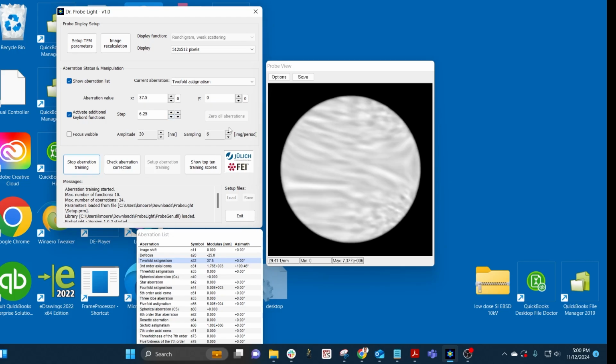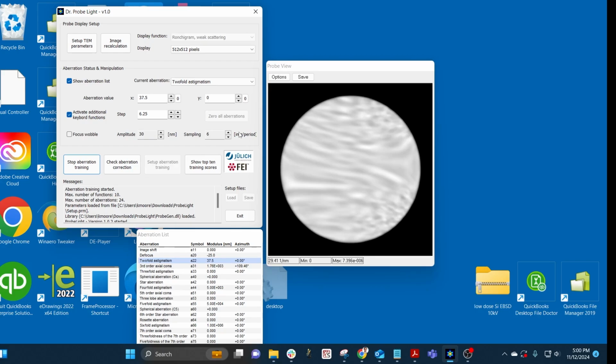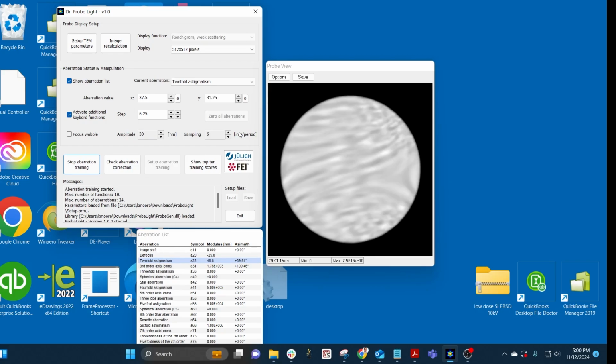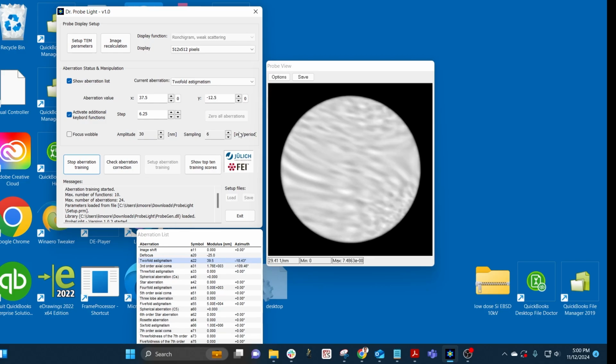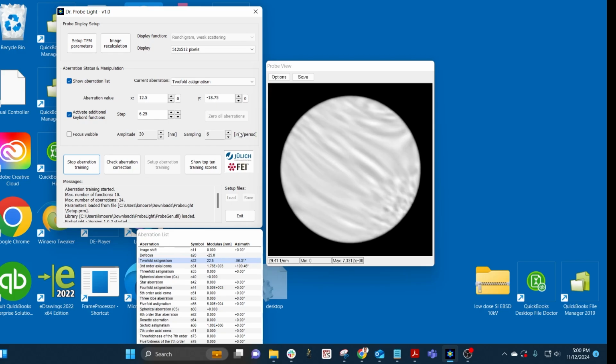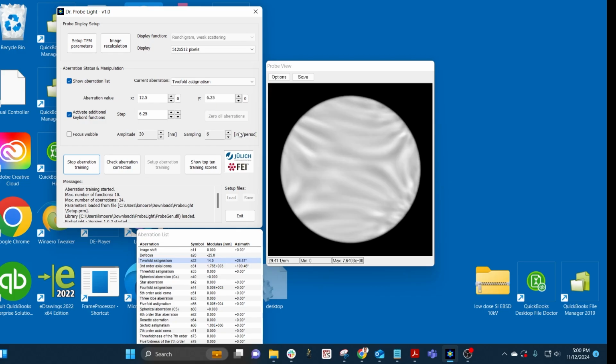So that's zooming out. Again, similar to the other stigmator, that's the wrong direction. So I'm going to try to zoom in. Just to show an example, I'll show how it would look if I use the wrong stigmator. So now you can see it's rotating. So that's wrong. So go back to where it was, I think that's where it was, and try to zoom in. It's rotating a bit, so zoom in, zoom in, zoom in. Ooh, a bit of rotation, so I'll go back, drop the step size again.